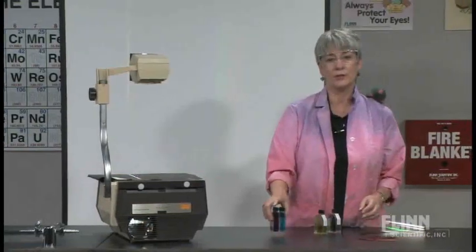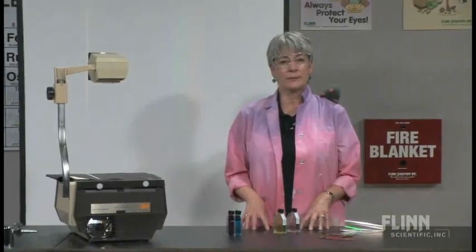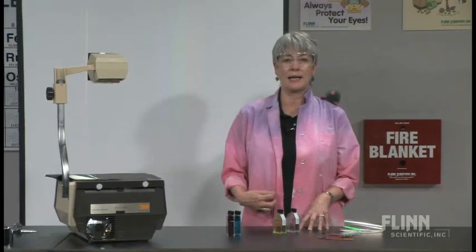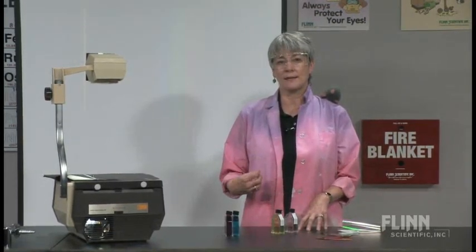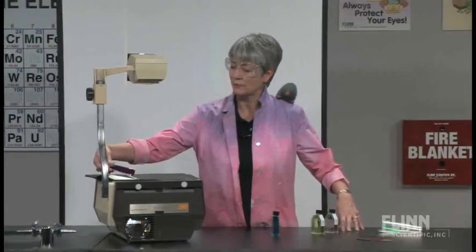I'm going to show you some colored solutions, and we're going to look at the color of the light that's transmitted — what we see with our eye — and then what's missing, which is the color of light that's absorbed. For the potassium permanganate solution, you can see on the screen that it's absorbing strongly in the green-yellow region — green-yellow for potassium permanganate.